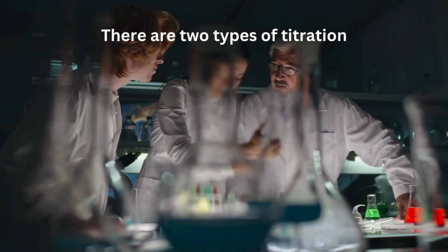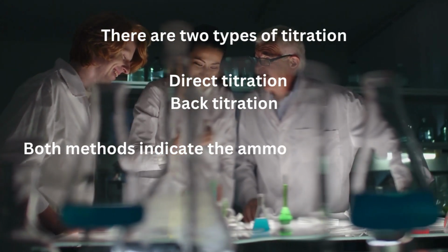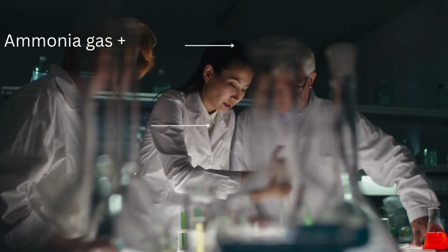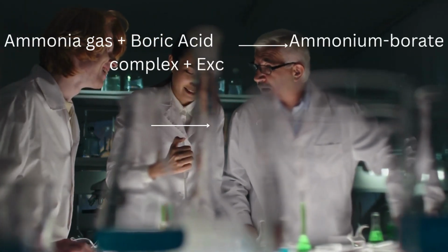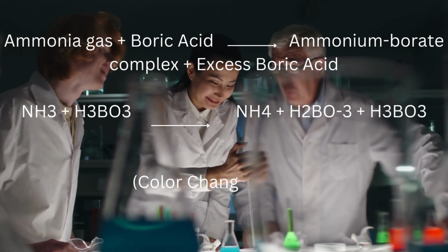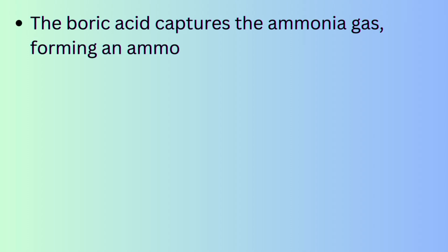There are two types of titration: direct titration and back titration. Both methods indicate the ammonia present in the distillate with a color change. In direct titration, boric acid is used as the receiving solution instead of a standardized mineral acid. The boric acid captures the ammonia gas, forming an ammonium borate complex. As the ammonia collects, the color of the receiving solution changes.